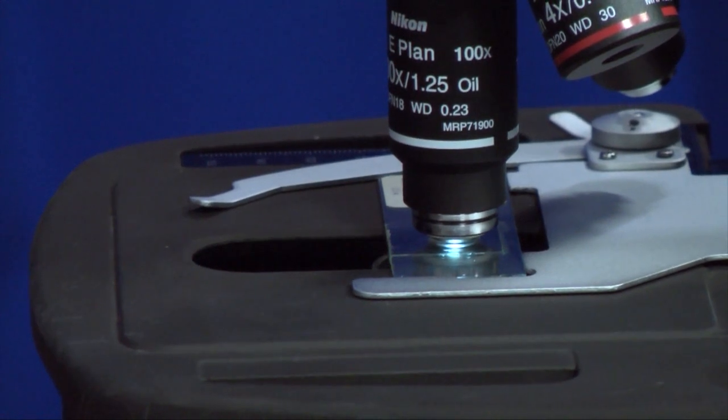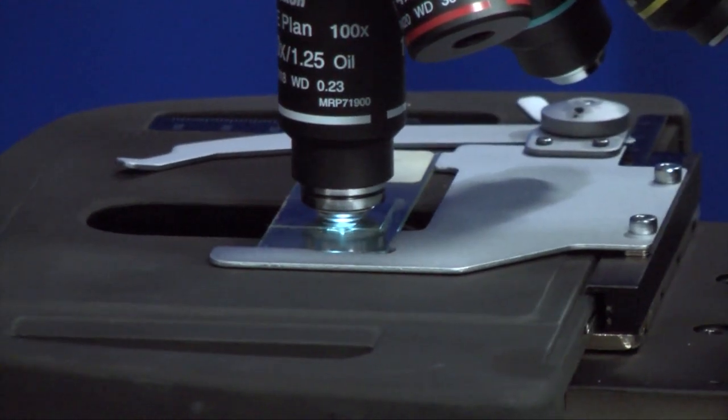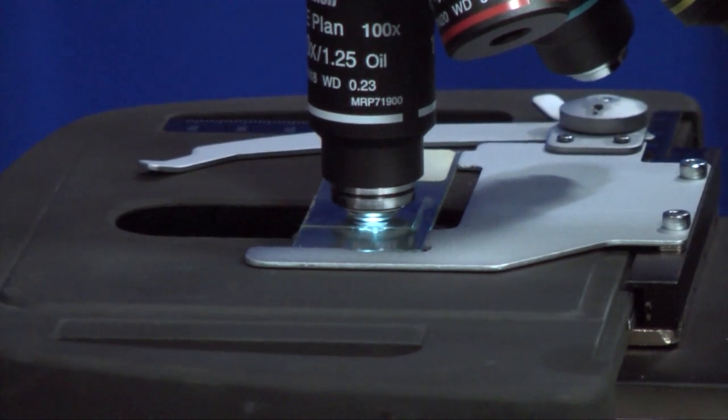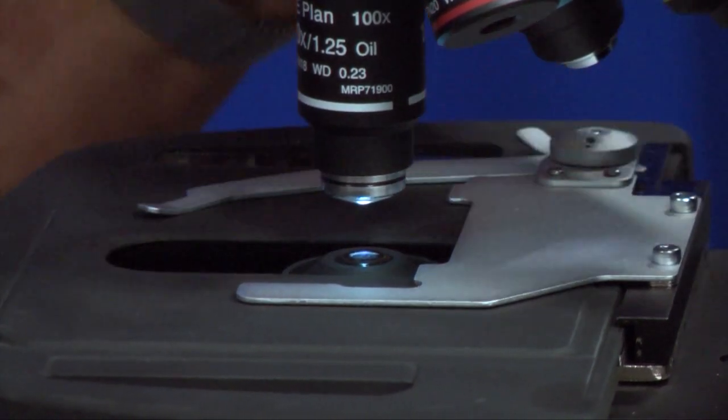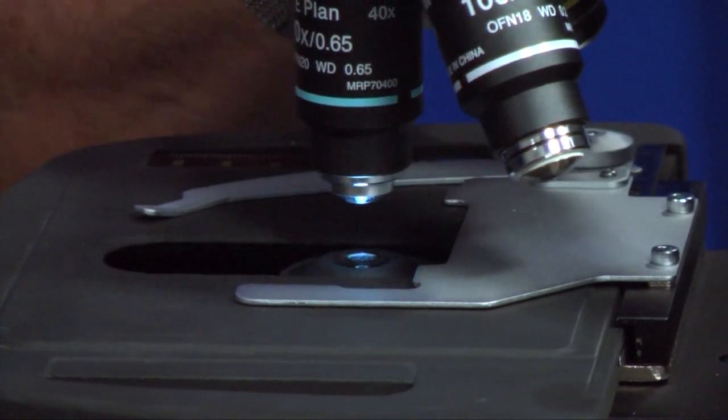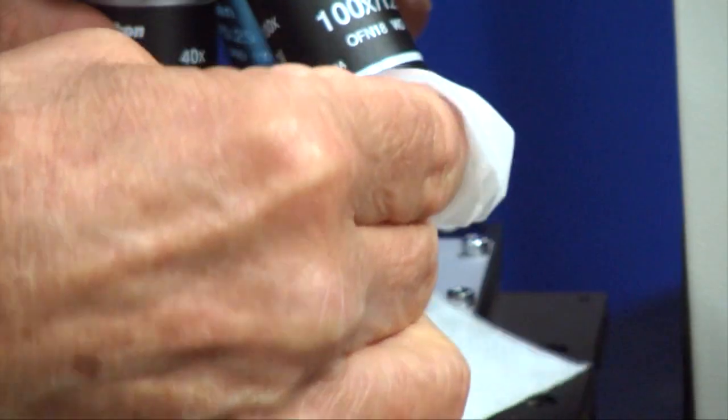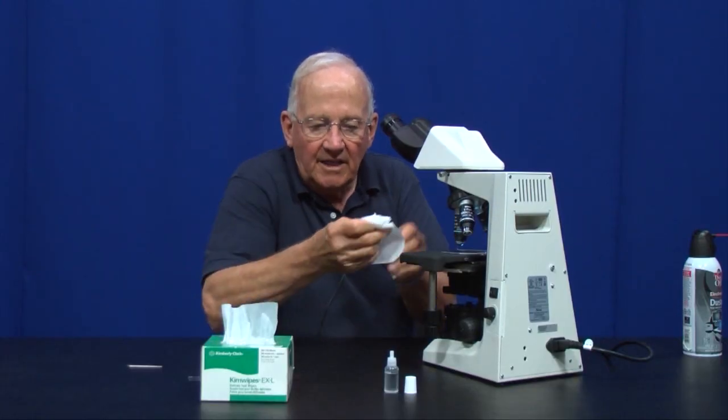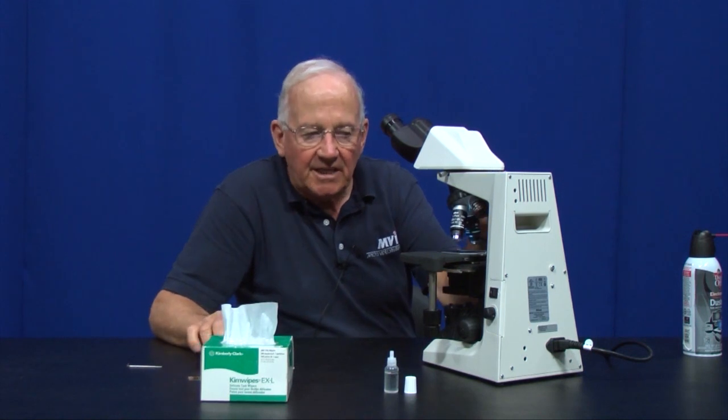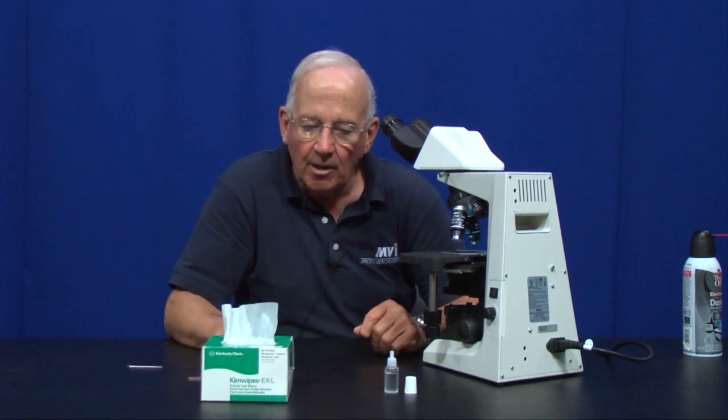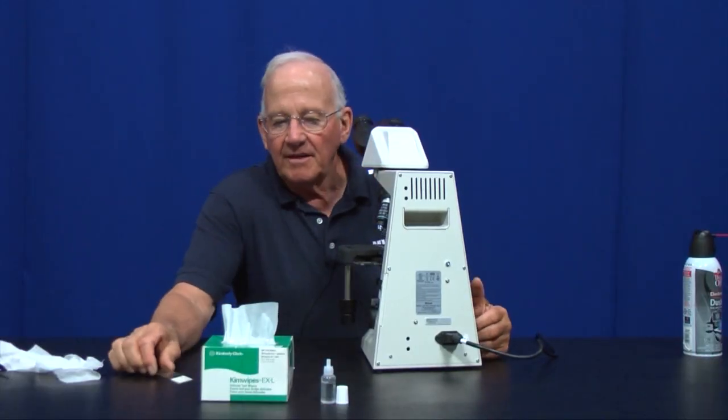What's very important about this 100x objective is that after you get through using it, you clean it off. After I get through observing with the 100x objective, I should rack the stage down, take the slide off and clean it with alcohol. Now the objective has to be clean. This would be a good way to do it after every session with the microscope. Take lens paper and wipe the oil off the 100x objective like I'm doing now. Every once in a while, the objective needs probably a little bit more attention than that. But the technician will clean the objective by removing it from the microscope. The normal user can do this and wipe the oil off the objective like that.